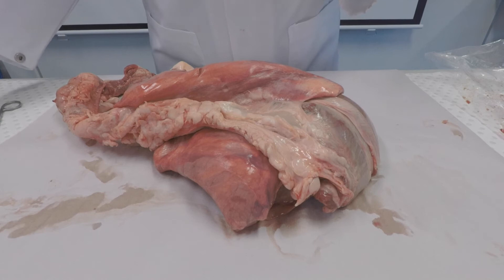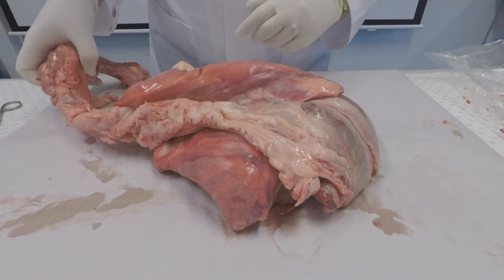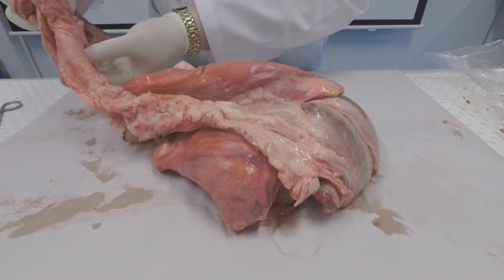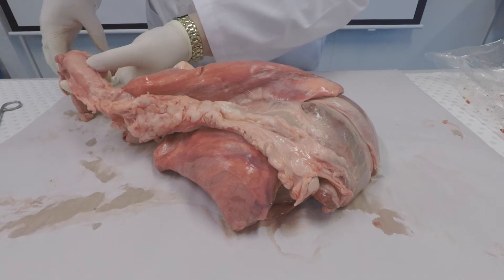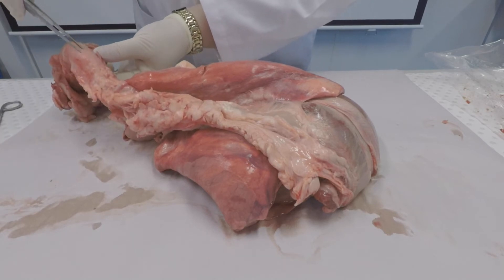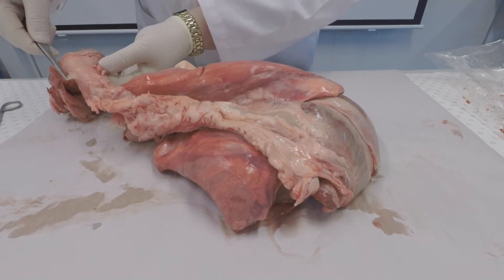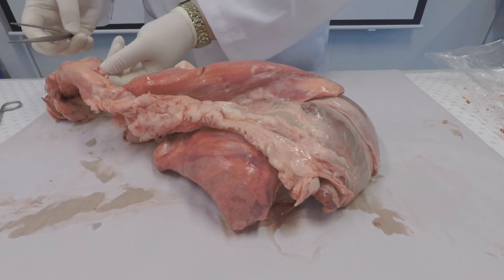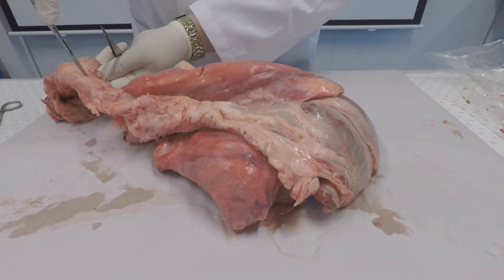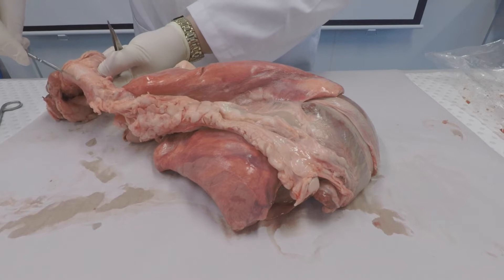Today we're going to do a lung dissection. This is a porcine, or pig, pluck. I'm currently holding the trachea, commonly known as the windpipe. It allows air to move in and out of the lungs.